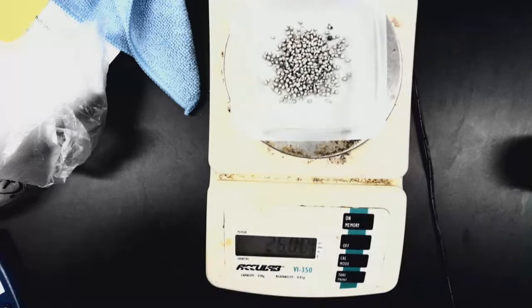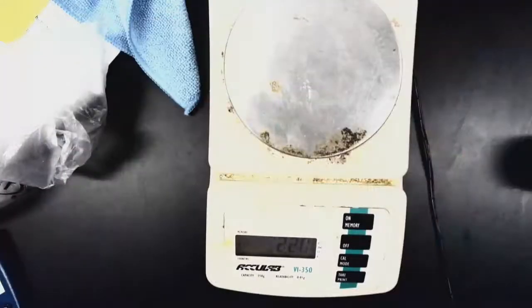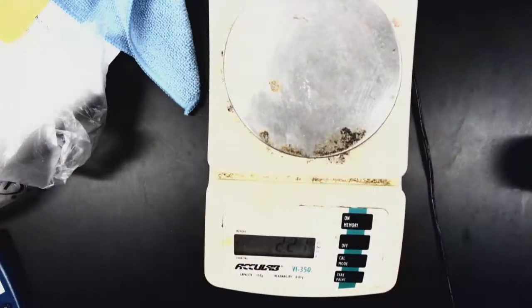For our procedure, it says to obtain a calorimeter and put it on a balance and zero it. It wants us to fill the calorimeter with 40 milliliters of distilled water at room temperature and record the mass in the data table as mass of H2O. So I'm going to go ahead and remove my metal that I have on there.